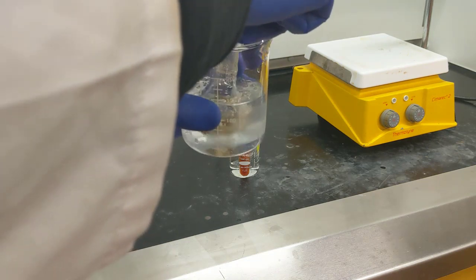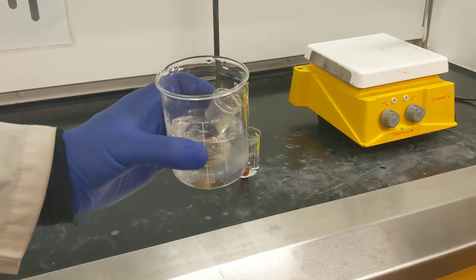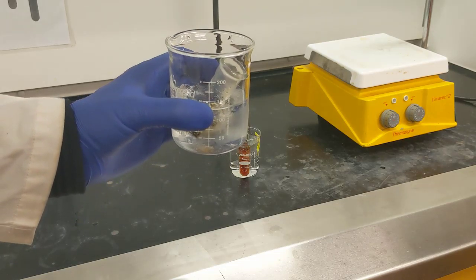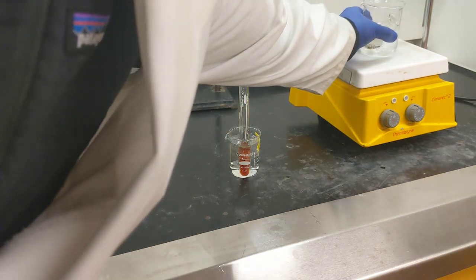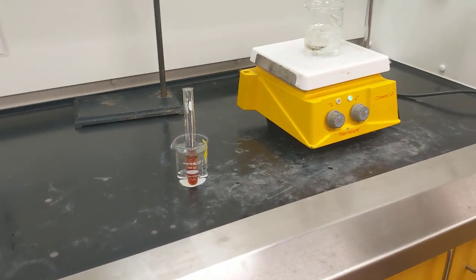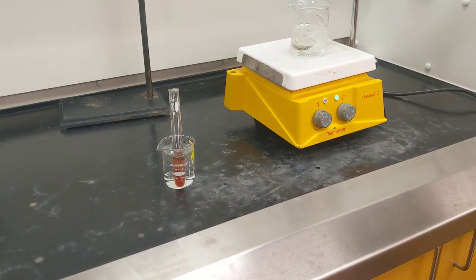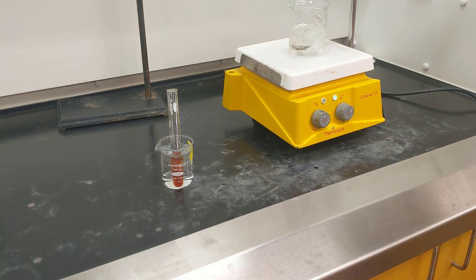I'm just going to trust that this little beaker holds everything upright because I can't get my clamp to clamp the neck of the flask while it's in this ice bath. So there we go. I've got my round bottom flask stirring with my reagents. I'm still waiting on the precipitation in test tube A to finalize, so I'll give this a few minutes longer.